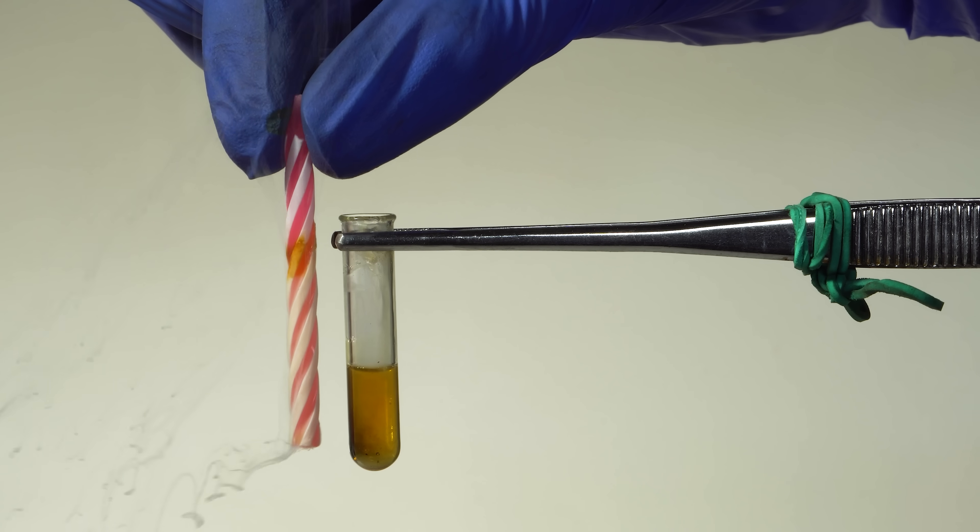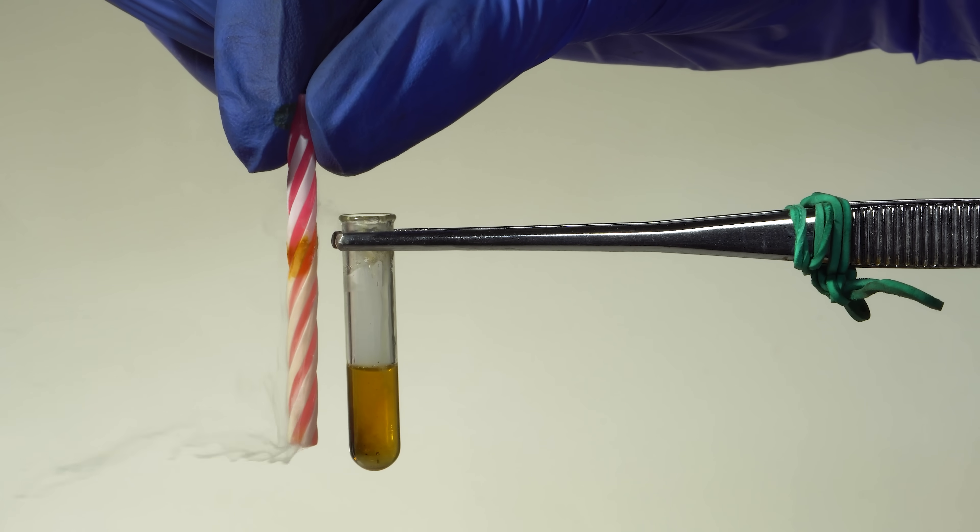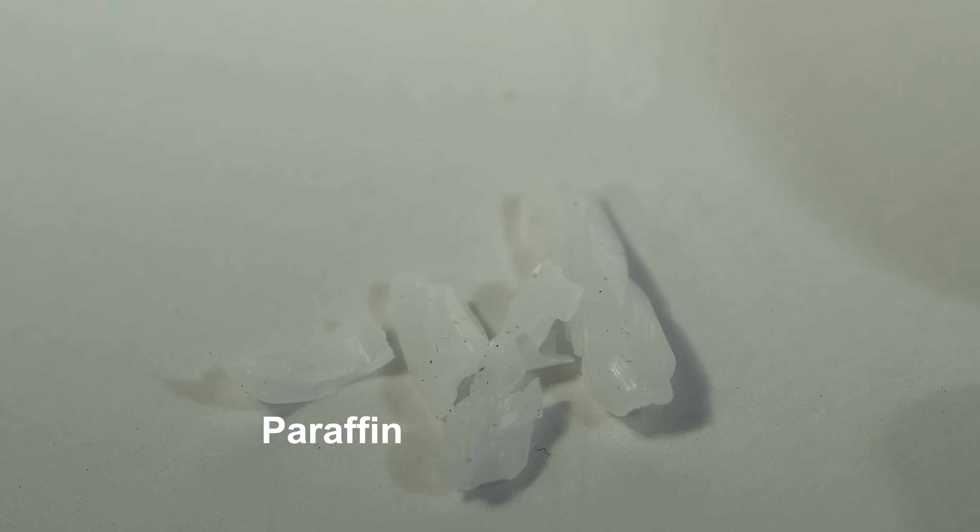Okay, maybe this candle was too big for the volume of magic acid given, so I decided to use a small piece of pure white paraffin.